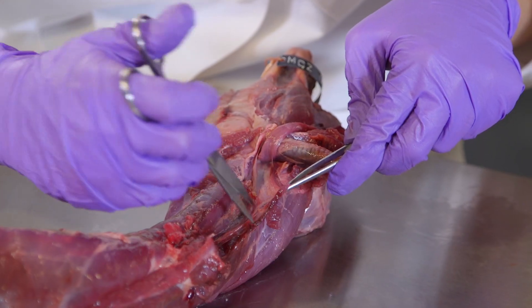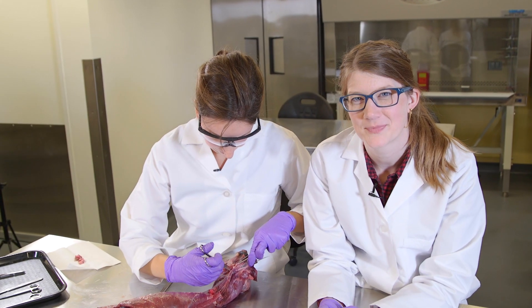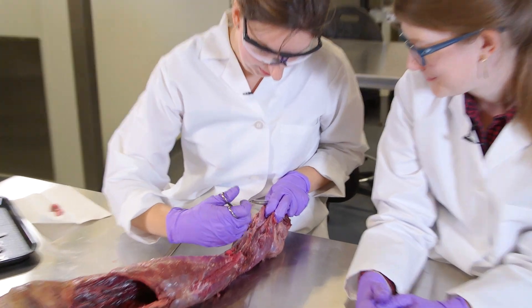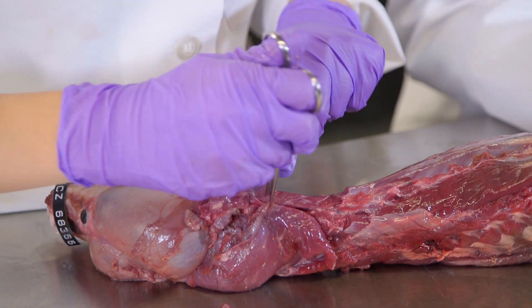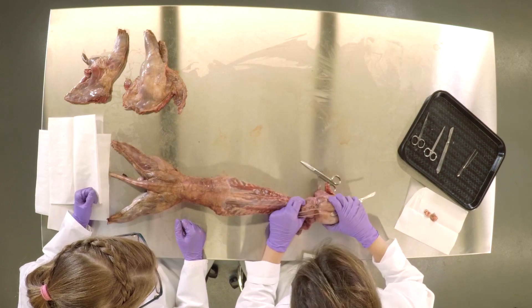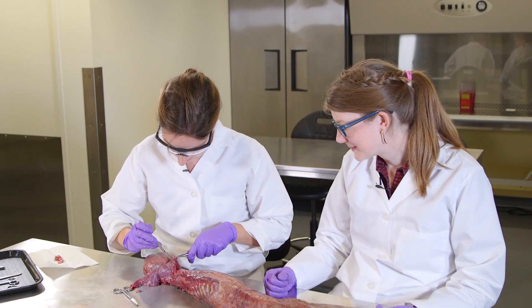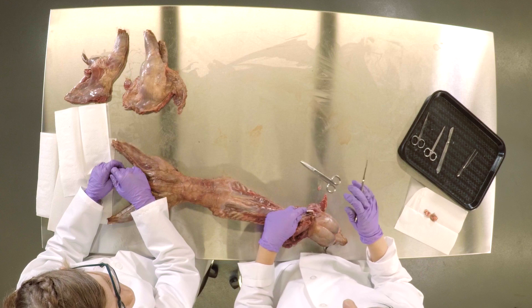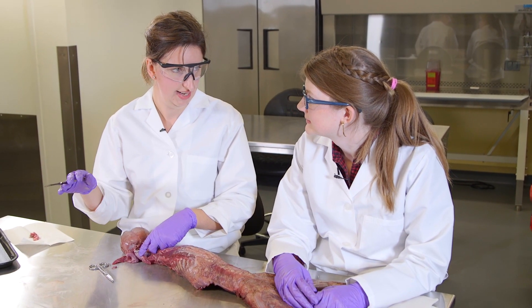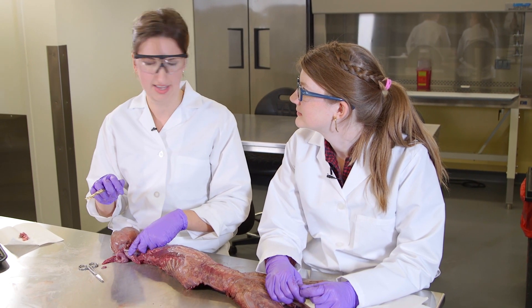Should we do a head next? There are lots of very important things connecting the head and the body going on here. We're working our way through these layers of muscles, hoping to get to the joint that connects the head and the neck — it's called the atlanto-occipital joint. The top two vertebrae in mammals, the ones closest to the head, are really specially shaped. The one that connects the head to the neck, the atlas, only allows movement like this — nodding. And the one beneath it, the axis, only allows movement like this — rotation. So it's like the yes joint and the no joint, and they work together to produce all other movements.